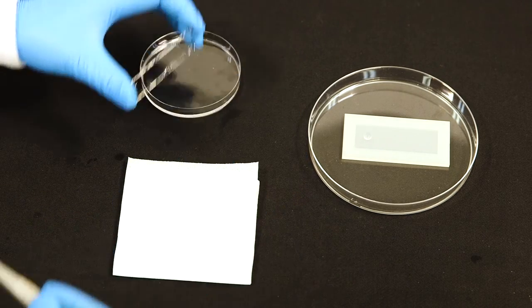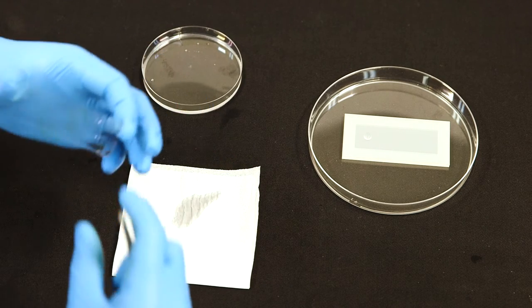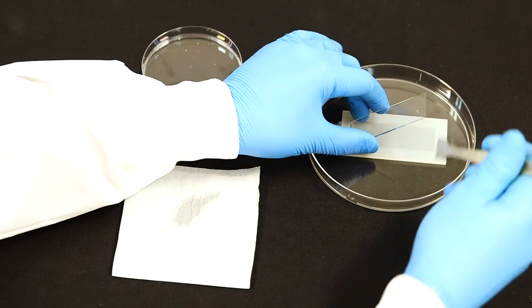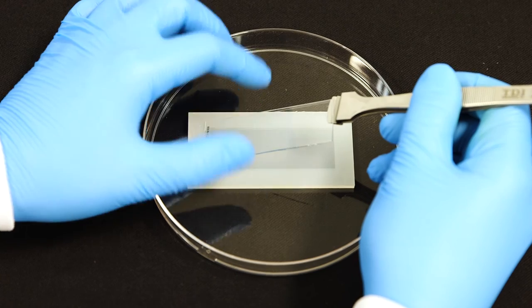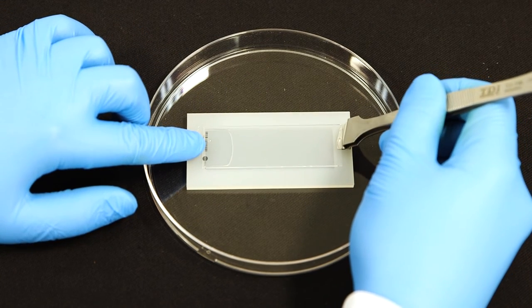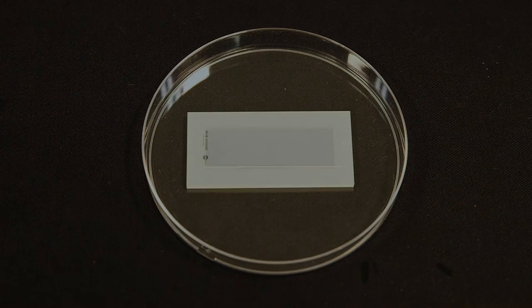Remove the chip from the petri dish containing wash buffer, and carefully lower it gel side down, like you're applying a cover slip. You should lower your chip at an angle so that the antibody solution wicks across the gel without creating air bubbles. The chip is longer than the reservoir and the barcode on the chip should end up just outside the edge of the reservoir.